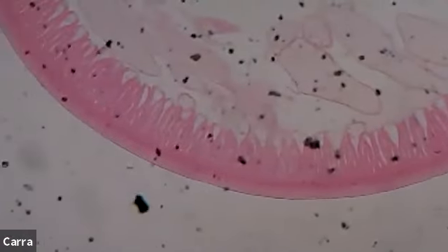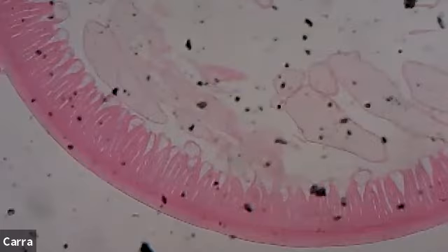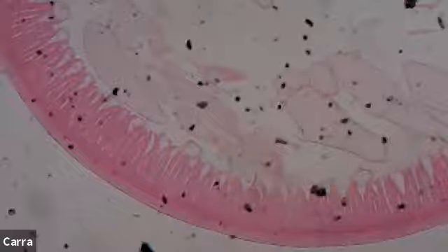But what I can do is go down to the bottom here. And so here, what we have is the ectoderm or the epidermis, right? And because this is a roundworm, the epidermis has a thick layer of cuticle. That's what it's going to shed when it undergoes ecdysis. And let's see if I can clean this slide up, y'all. All right, yeah, that's so much better. All right, and so we see the ectoderm and then we see the muscles. See those little fibers?